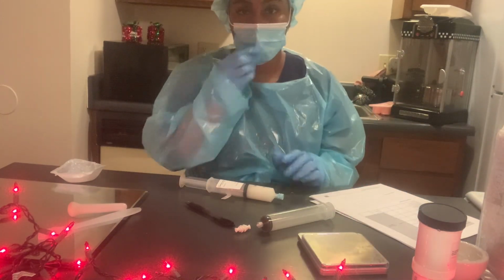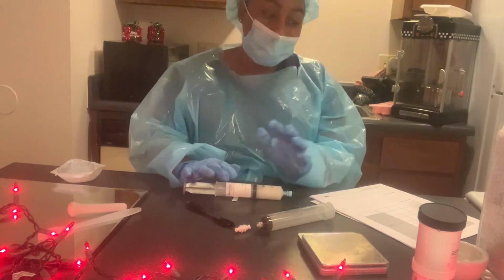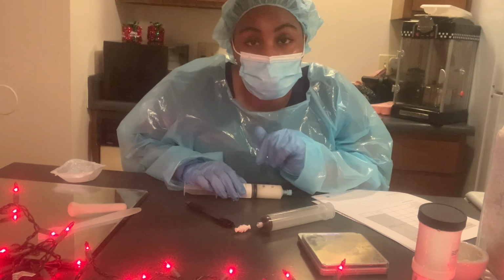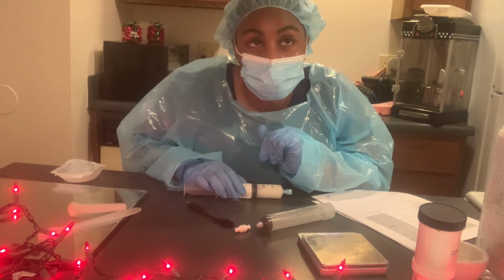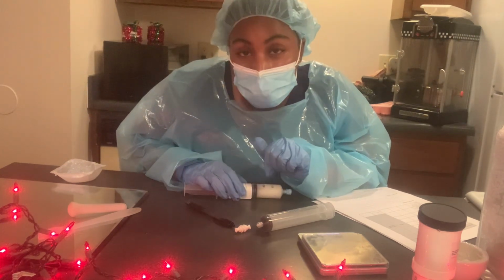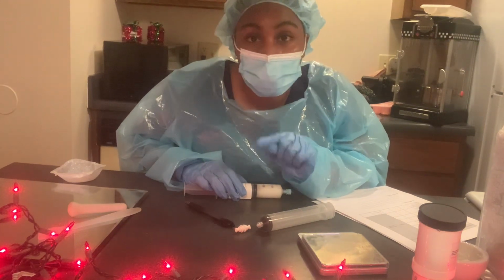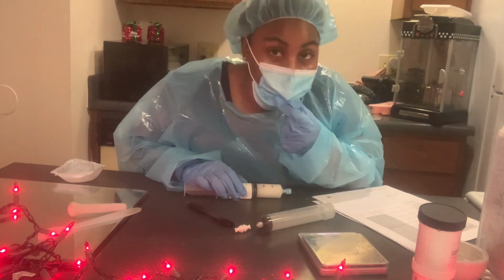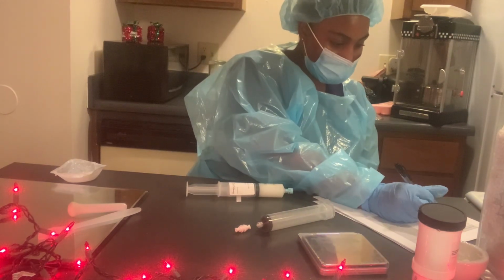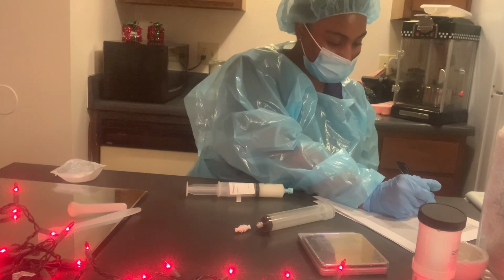Okay, so we gotta assign our beyond use date, which is 30 days from now, and that will be, so today is December 14th, 2023. So 30 days from now is January 13th, 2024. So that's 30 days from now, which is our beyond use date. Complete the compounding record correctly and return with assessment form.